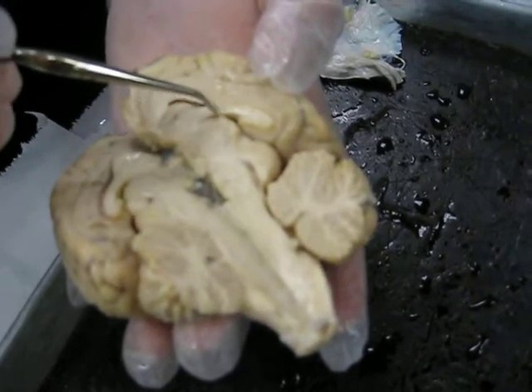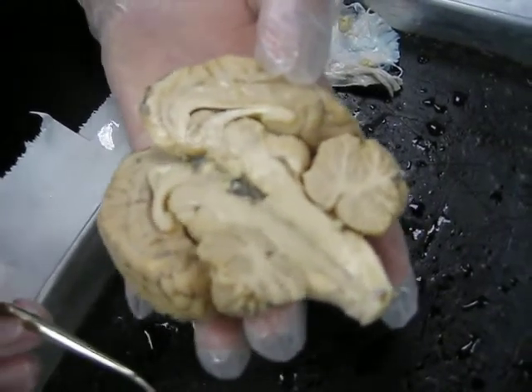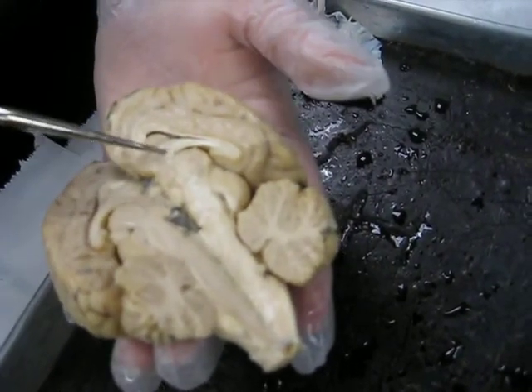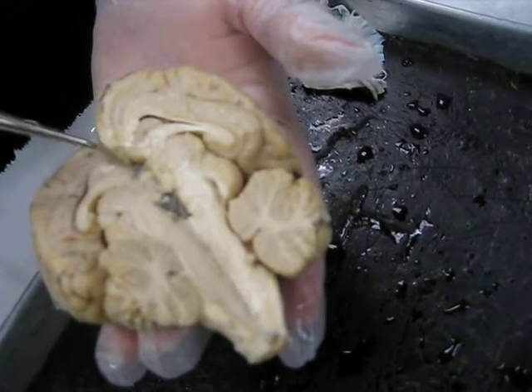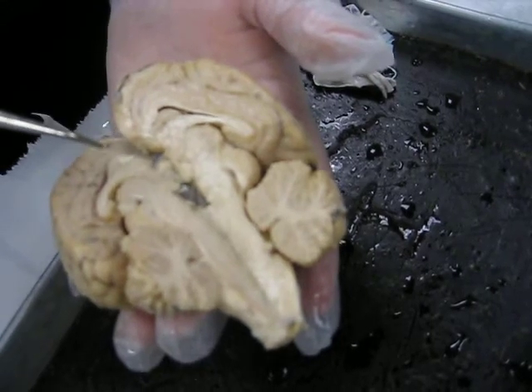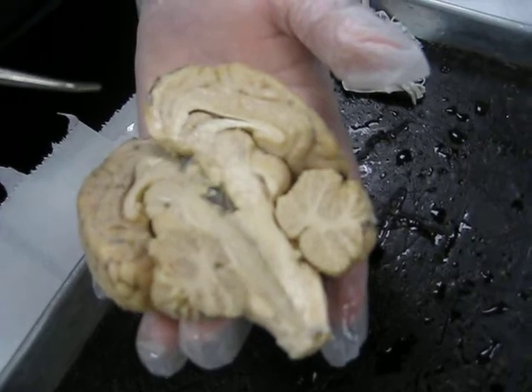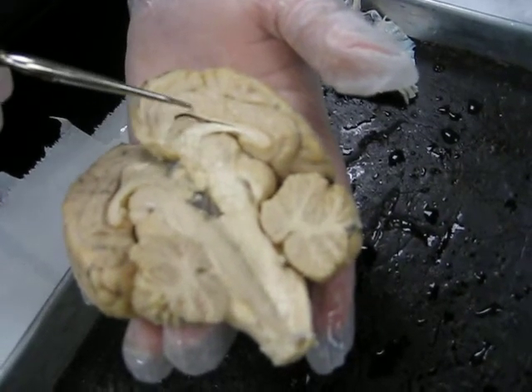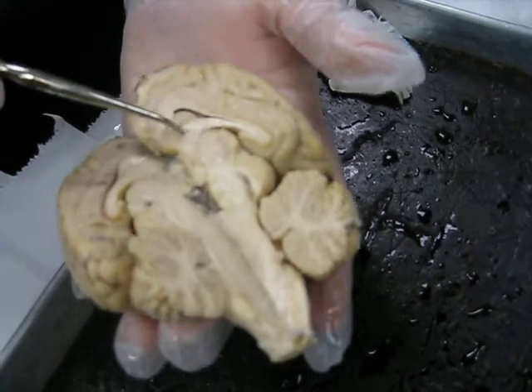So she's going to go back to the other half. You'll see the fornix a lot more clear. She should have stayed with the other half. You can see the fornix coming down this direction, off the back end. The corpus callosum comes up and around, and the fornix comes downward. We'll have to switch back on that one. I'm going to have to go back and forth between these a little bit so that we can see. This shows it quite well, actually. There's the corpus callosum. And then this white projection coming down here would be the fornix. And the lateral ventricle would be up inside there.